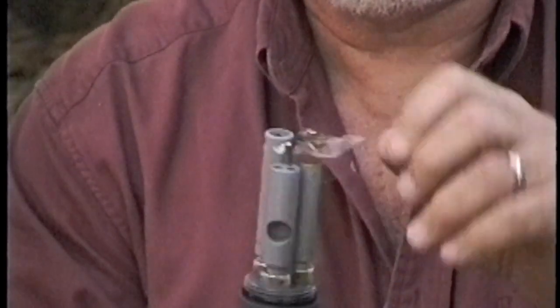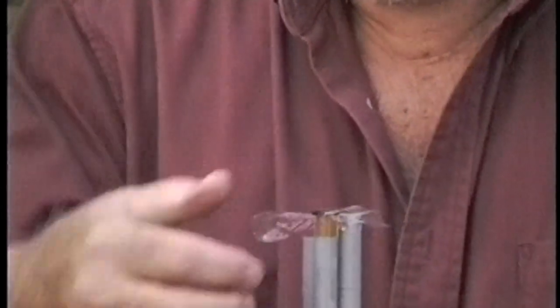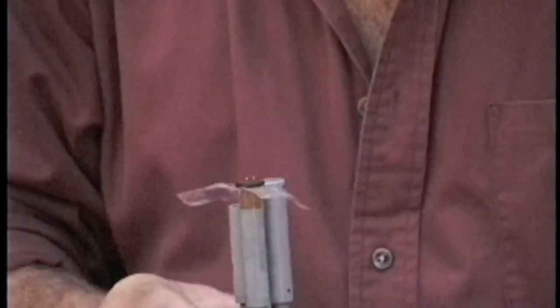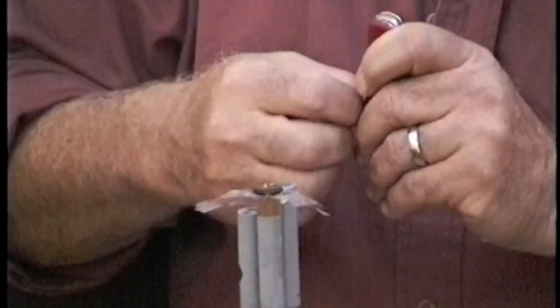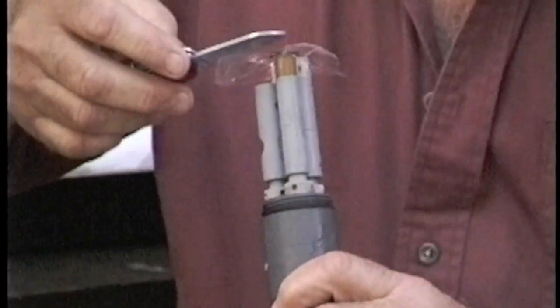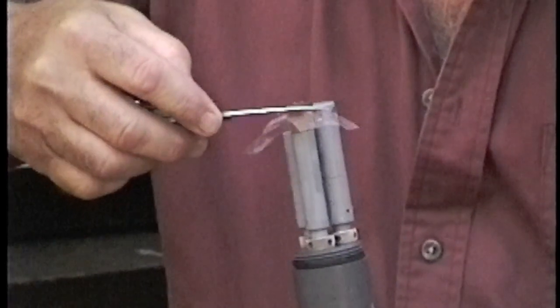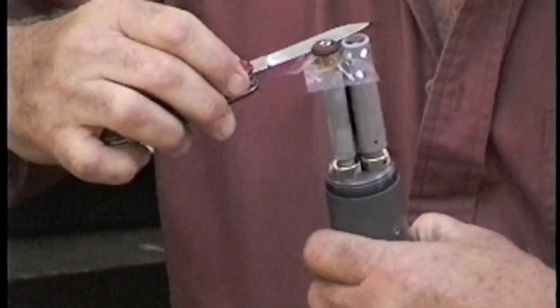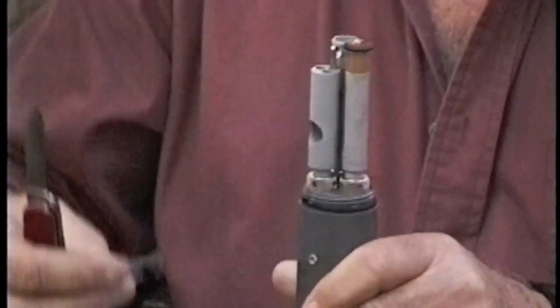You then see the membrane has a lot of extra on it. Make sure that the membrane is nice and taut, there's no bubbles, there's no wrinkles. Then you can, with a sharp knife, simply cut below the surface of the O-ring very gently. You can cut around the membrane and remove the excess membrane.